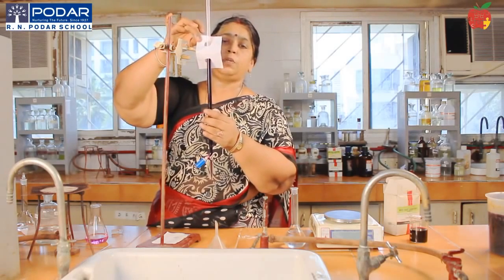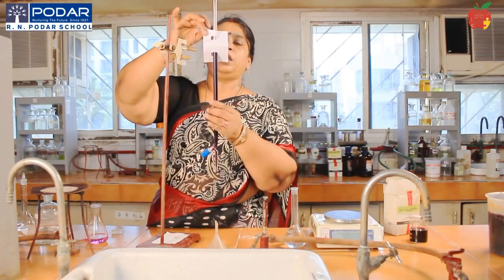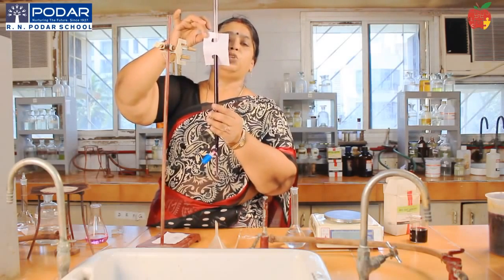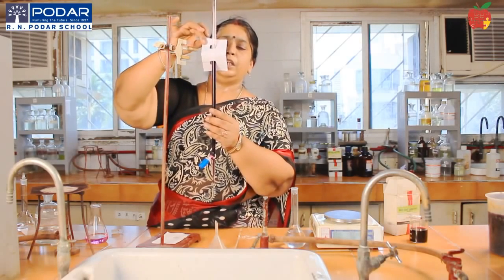Now, my reading is again 9.8. So don't write 9.89 and all. There are no two decimals. It is 9.8. Now I will take the lower one.